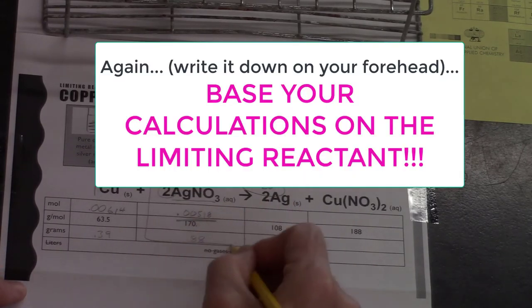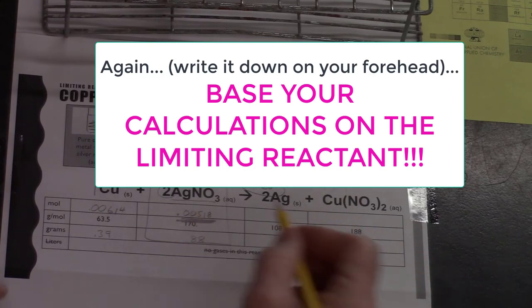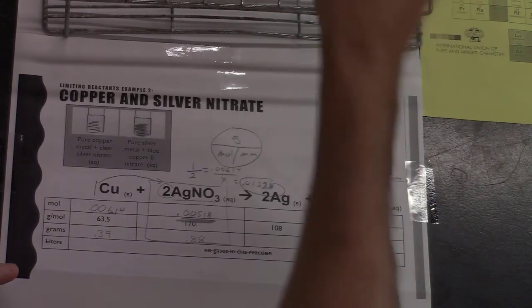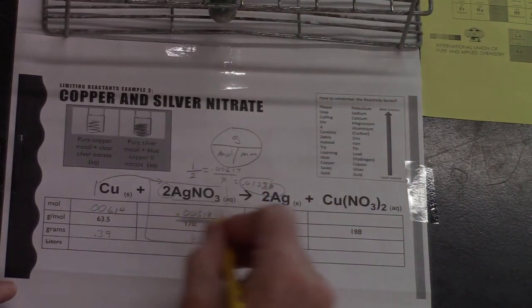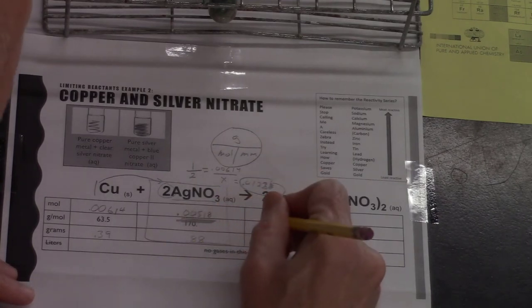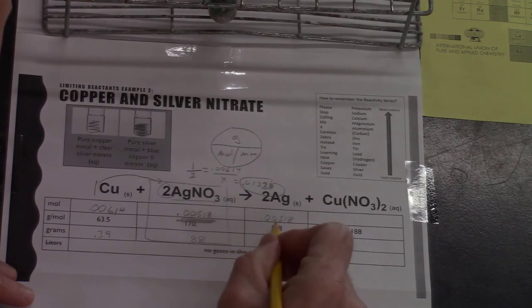And so from now on, I do all my calculations based on this. This is how much I use. So now I want to figure out how much silver I should make in this test tube. How much silver will there be? All right, so I say 2 is to 2, that's the same amount, as 0.00518. So I'm going to get that many moles of silver.